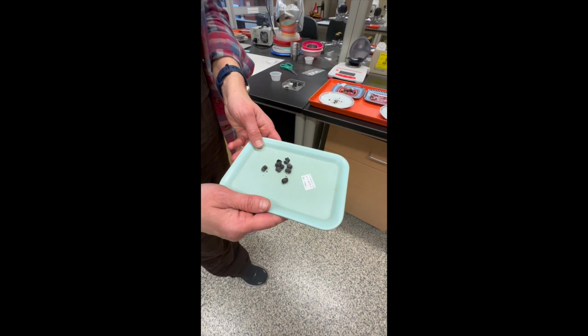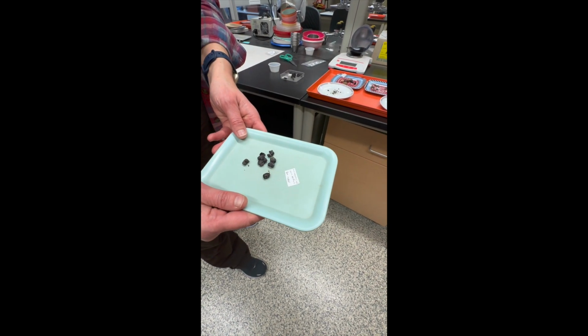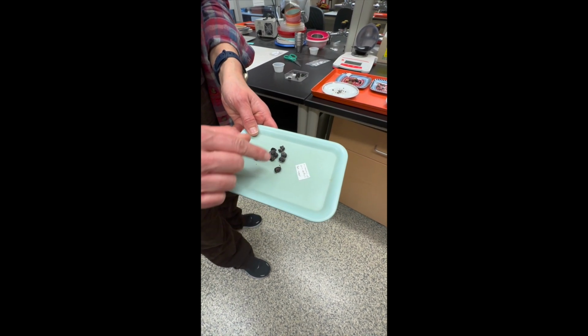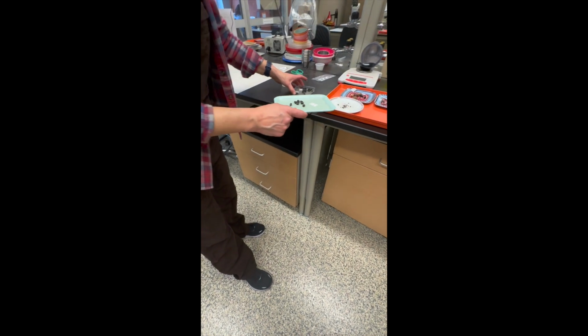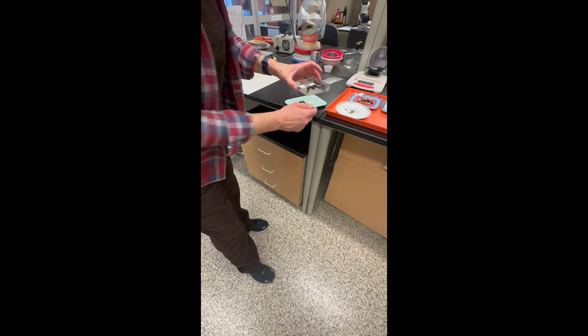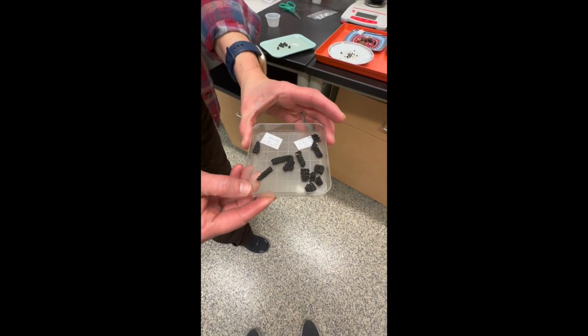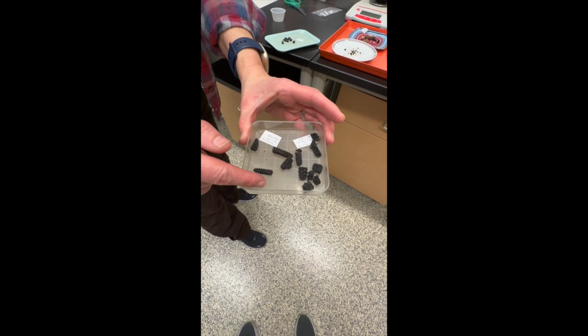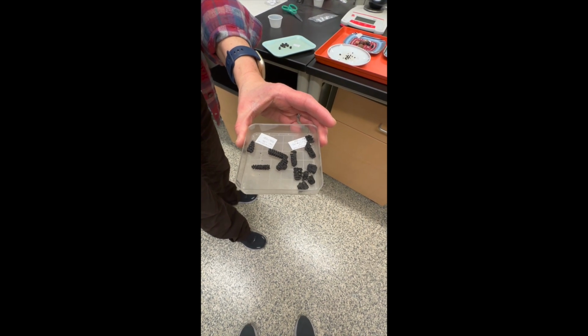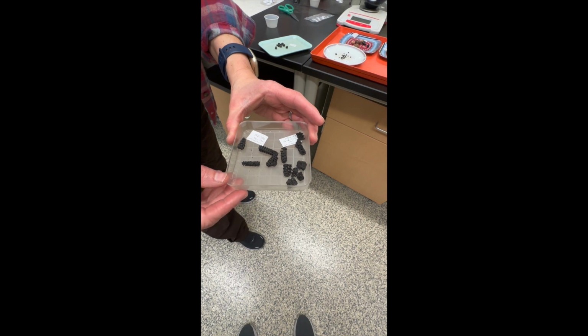But here's some examples of archaeological corn kernels. You can see that nice round shape. They look a little bit like corn pops. So go get you a box of corn pops. You'll never look at them quite the same. And then some examples of corn cobs. See how small they are? They're so tiny. Probably really early ones, but in some larger sections of corn cobs.